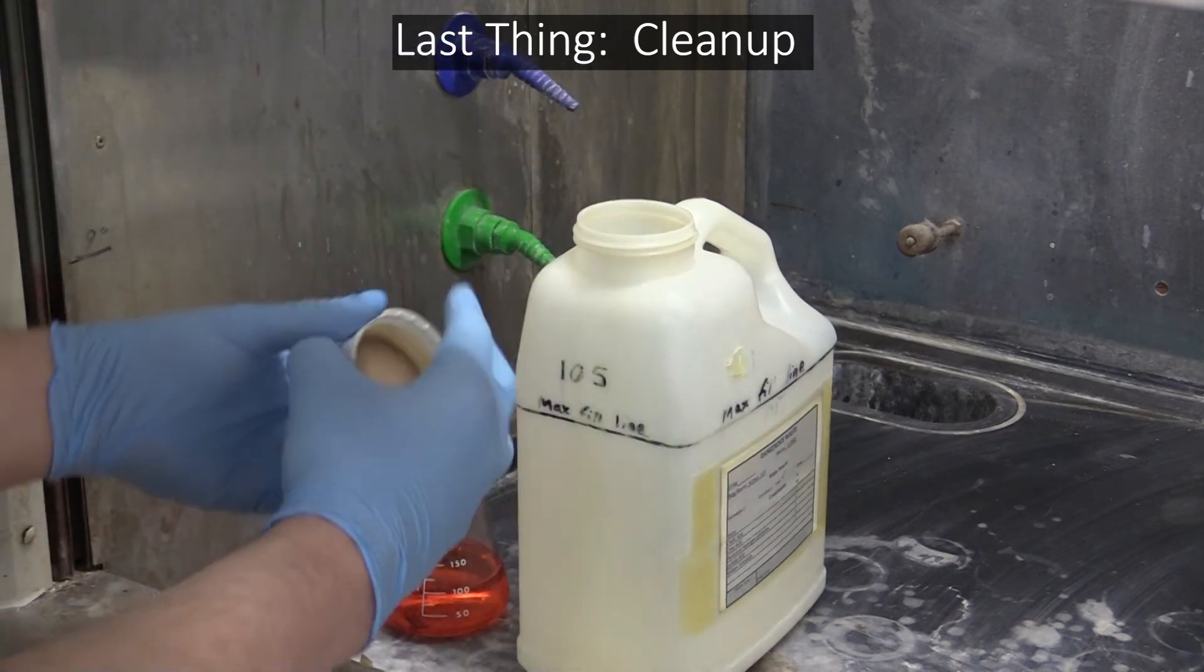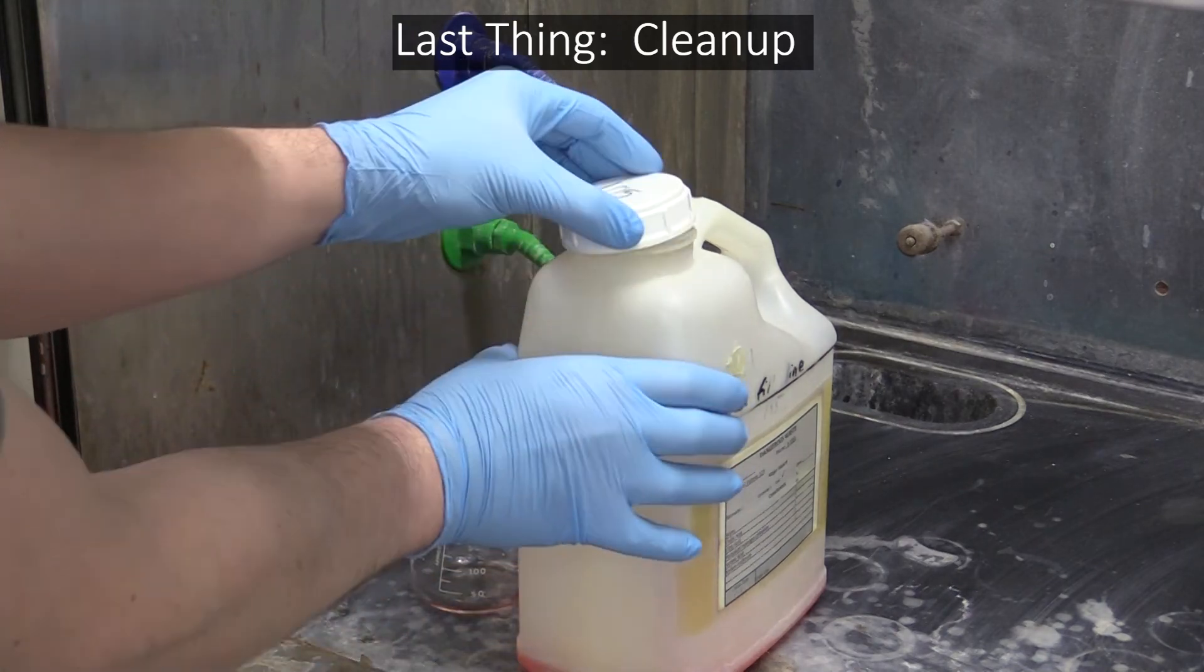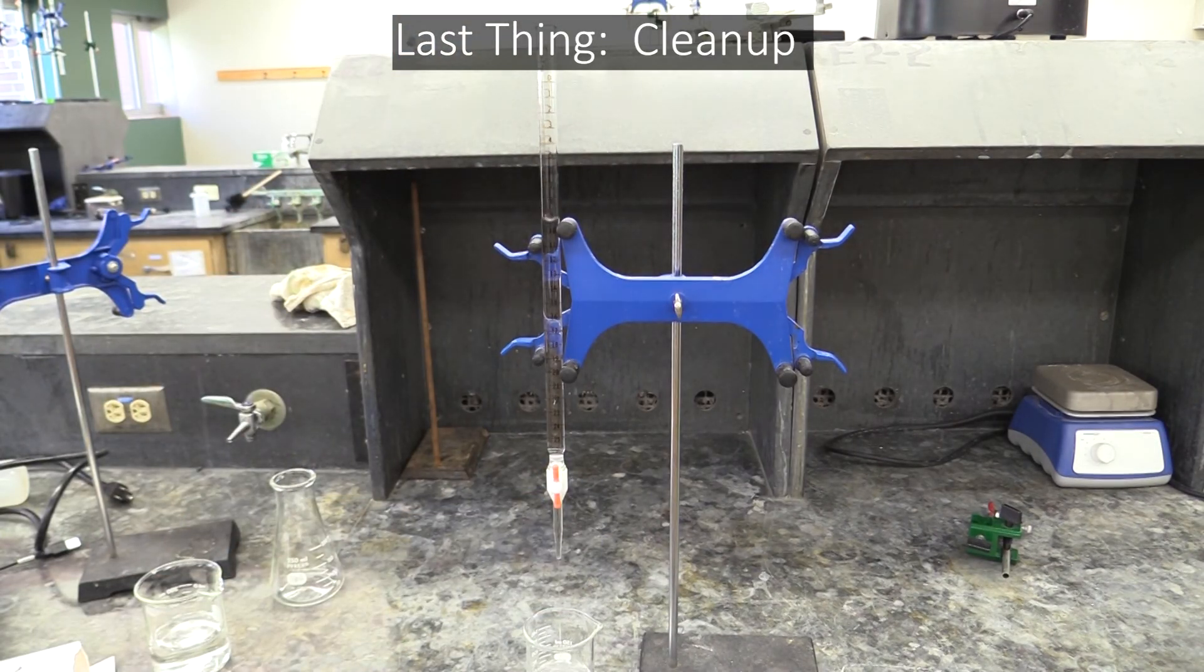As always, before you leave, make sure you dispose of all waste solutions in the proper container and clean up your glassware. For the burette, rinse it several times with DI water and leave it with its valve open.